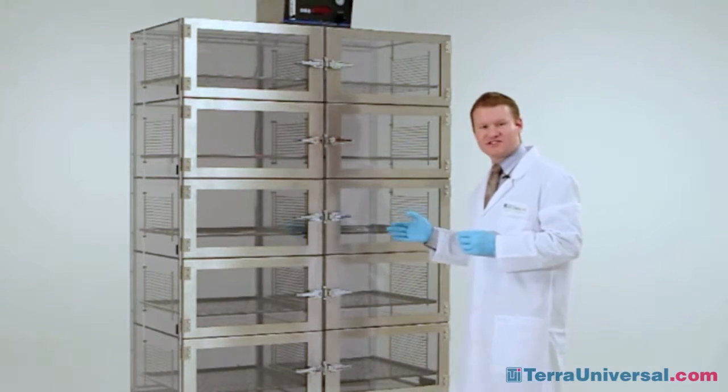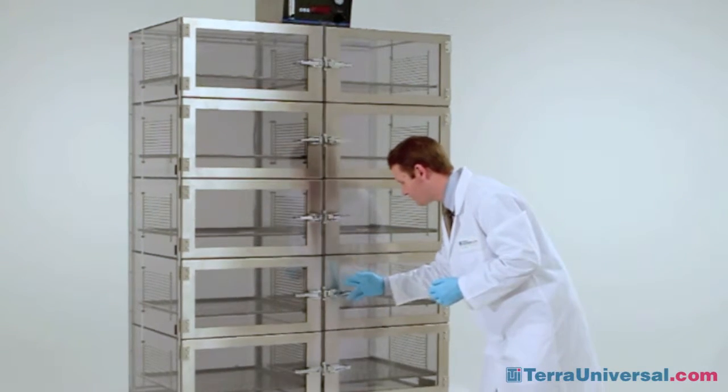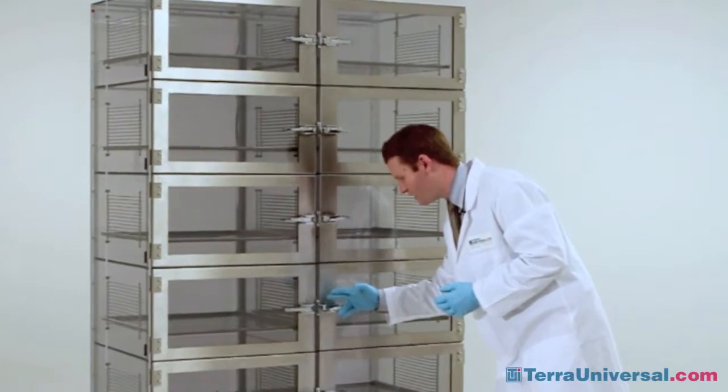The first step is an eyeball test on the door latches themselves. You need to ensure that the door latch is centered upon the corresponding catch.